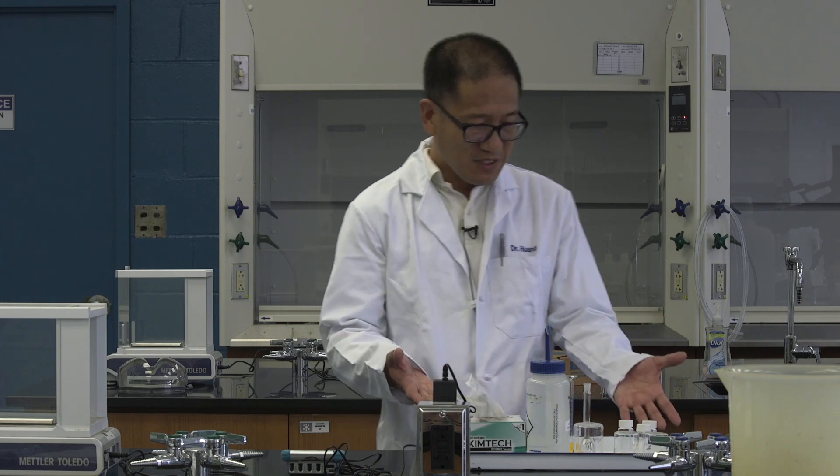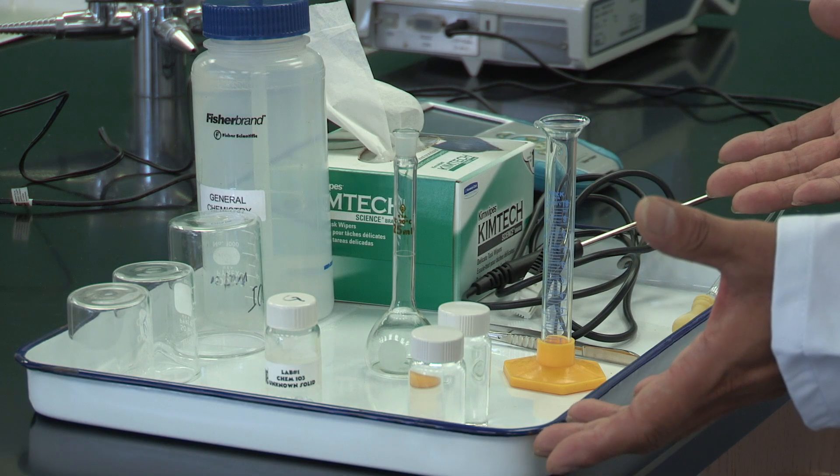Good morning. This is Dr. Huang. Today, I am going to show you the procedure for Experiment 1. This is what we need for Experiment 1. Before we do any experiment, we have to make sure we are safe, which means we have to wear lab coat and safety goggles.